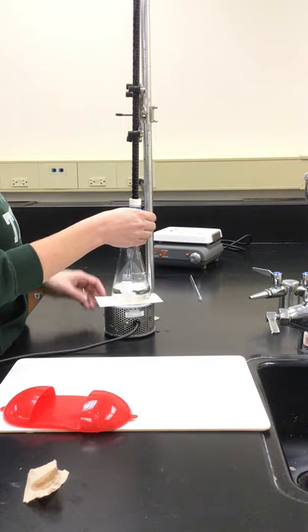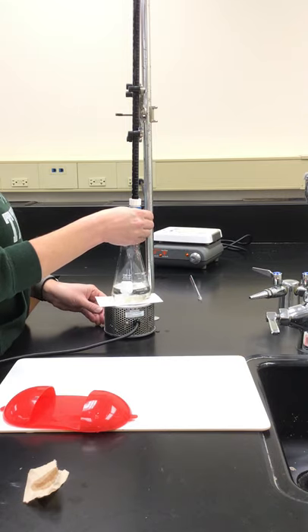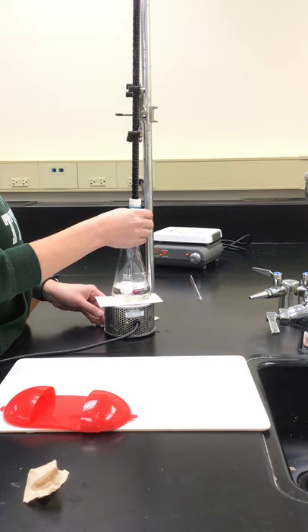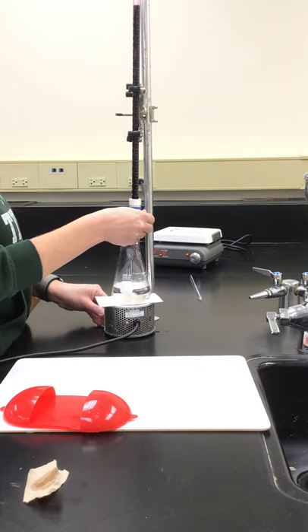Once again I have it on that white piece of paper just to make it a little easier to see when our light pink shows up. Getting closer, that light pink is lingering a little bit longer each time.